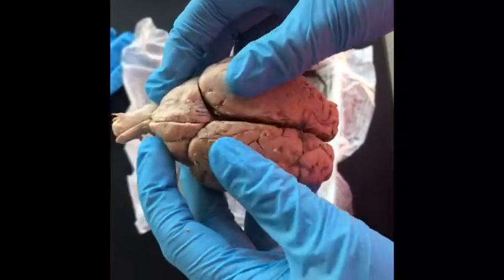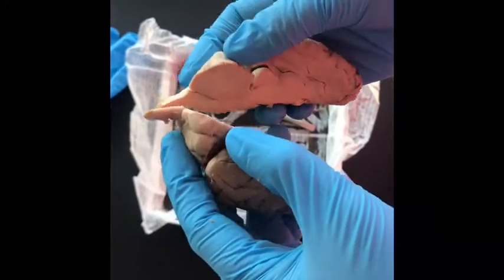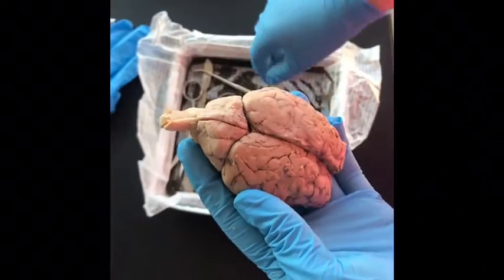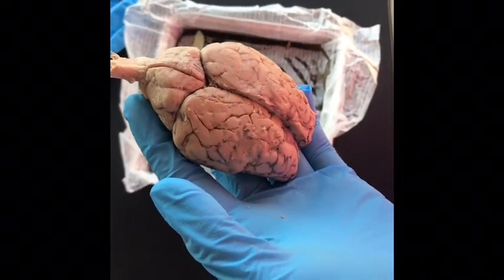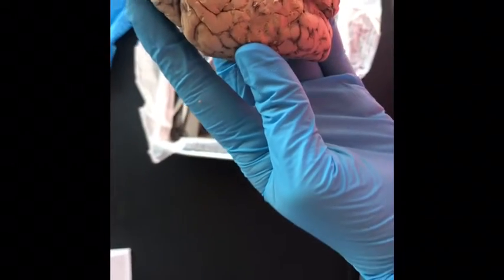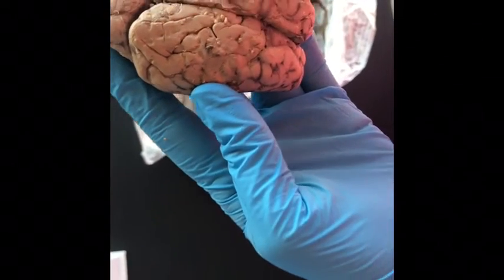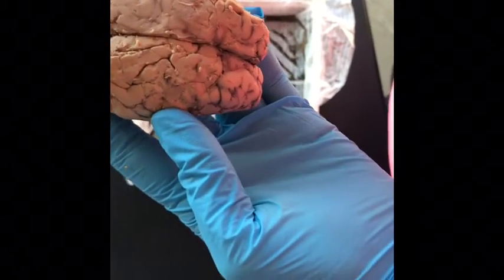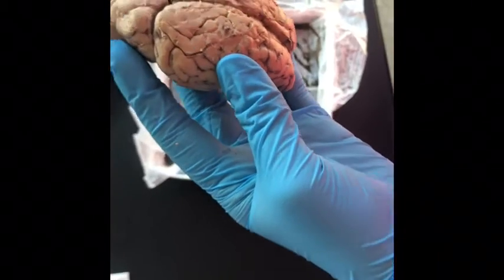The cerebral hemisphere is one half of the cerebrum, that part of the brain that controls the muscle functions and also controls speech, thought, emotions, reading, writing, and learning. Gyri are bumps that can be seen on the surface of the brain. The sulci are the grooves that fold, or ridges that make up the folded surface of the cerebral cortex.